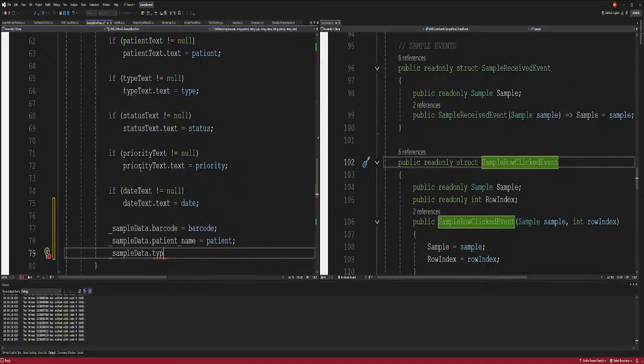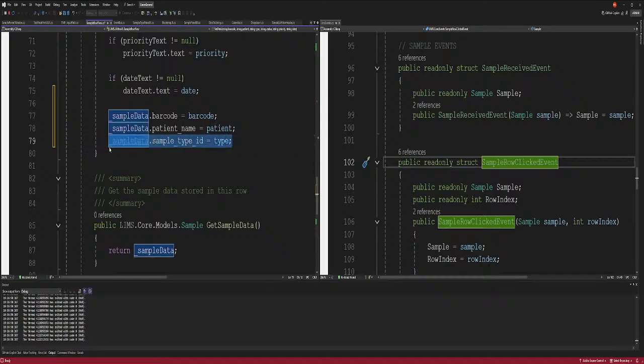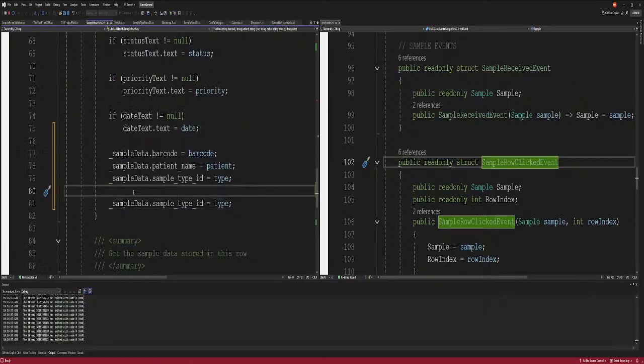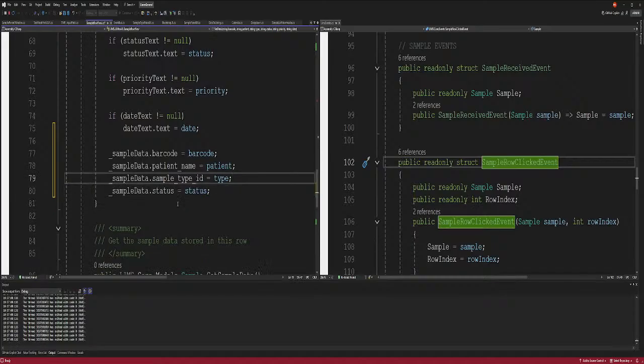Type. We have type. Sample type ID. No. Oh, I guess that's what it is. Is it type? I don't think so. I think that's wrong. There's something wrong with this. Patient status is okay. Type. Sample type. Yeah, we're gonna do that. And then we have status. That's gonna be status. Why skip a line? Because they're easy to read sometimes.